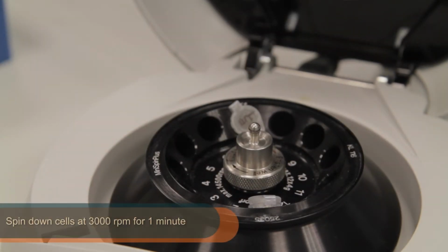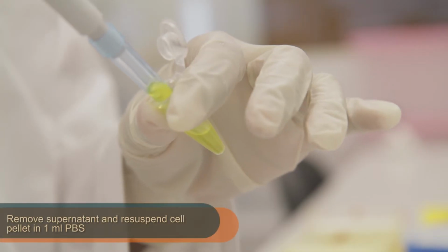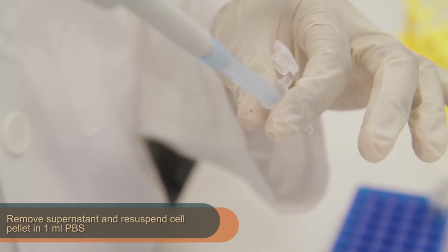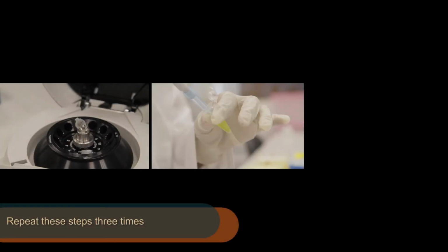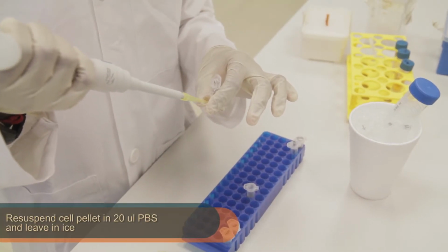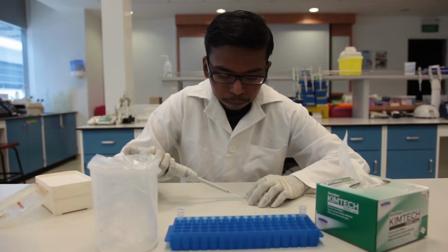Once again, spin down the cells at 3000 RPM for 1 minute. Next, remove the supernatant and resuspend the cell pellet in 1 ml of ice-cold wash buffer. Repeat these steps 3 times. Thereafter, resuspend the cell pellet in 20 microliters of ice-cold wash buffer and leave in ice.